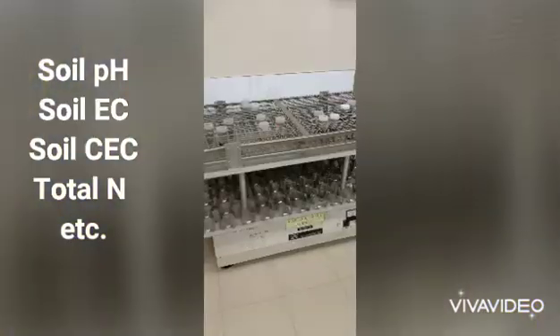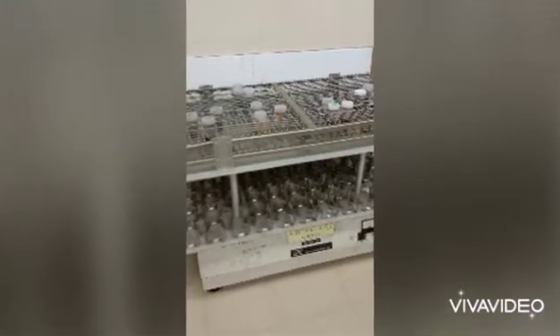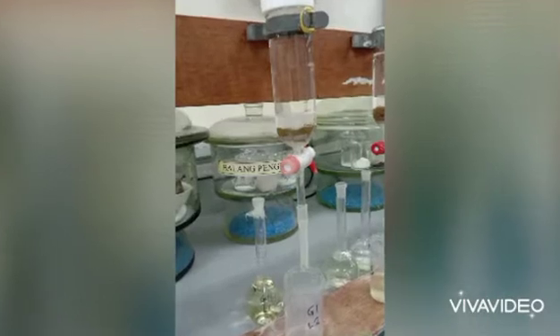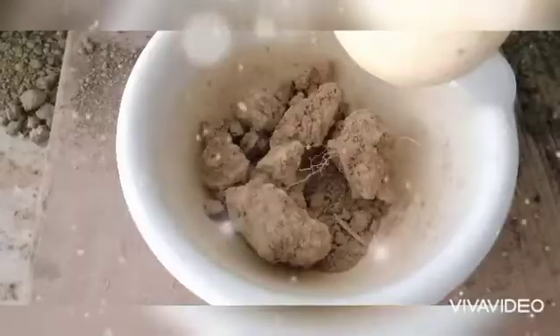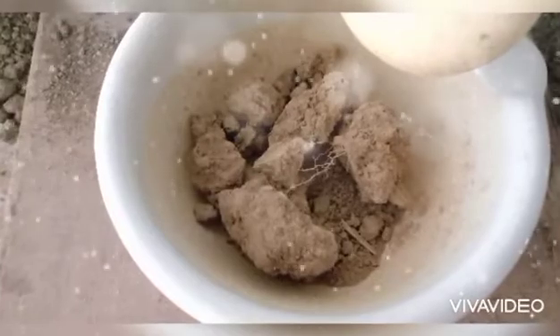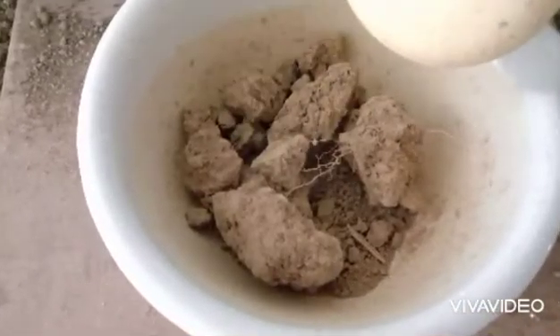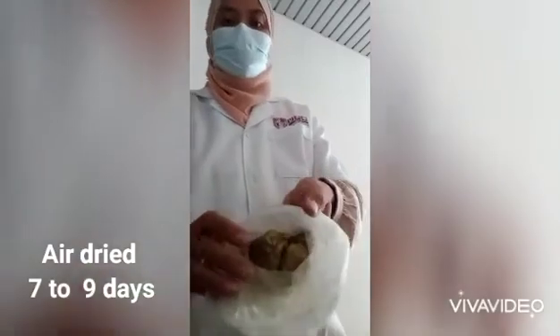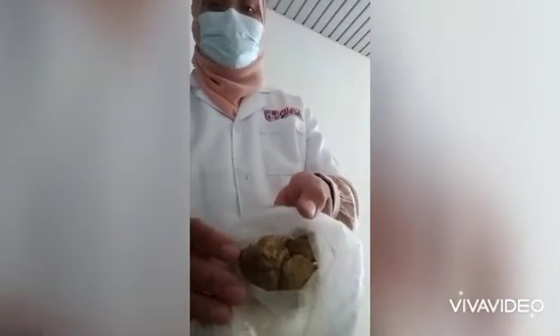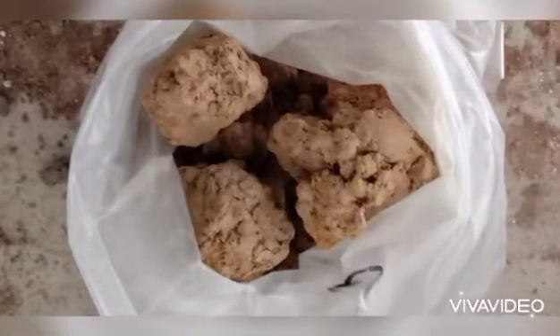EC, CEC, and so on. If you didn't know how to collect a soil sample for soil analysis, please refer to technical staff in your campus. Please make sure that the soil that you're going to use must be air dried. This soil must be dried under shade for maybe about seven to nine days; however, this will depend on the environment in your area.